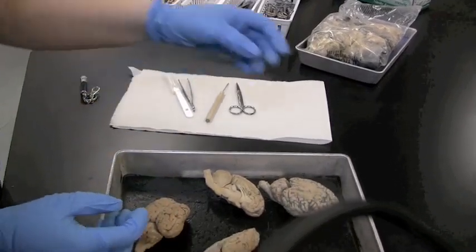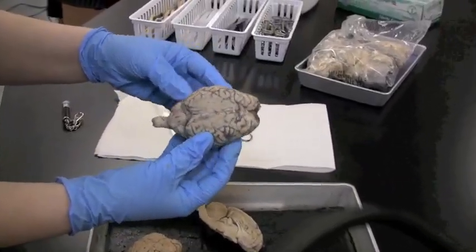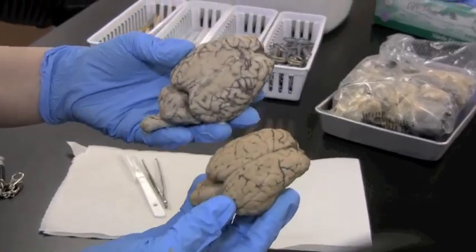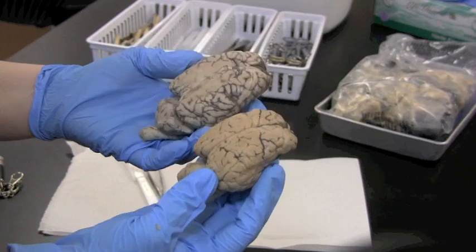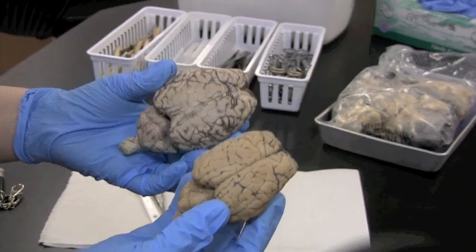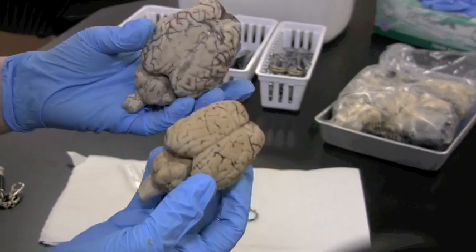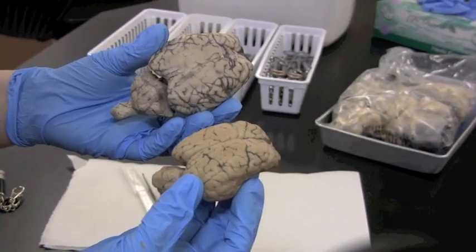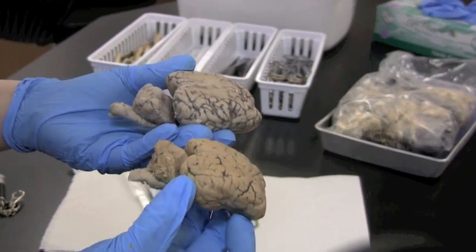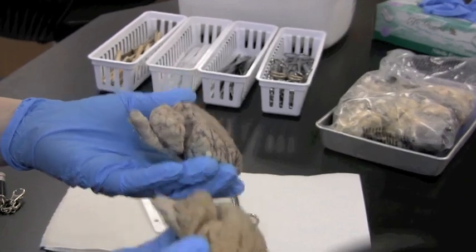Starting with our sheep brain, we have a whole brain here. This is the superior view. These are two different sheep — one's larger than the other. You might think these are pretty small brains; they're not baby sheep. I too was surprised when I first saw a sheep brain. I thought they'd have really big brains from all that time grazing in the meadow, but turns out they're pretty small — not that bright.